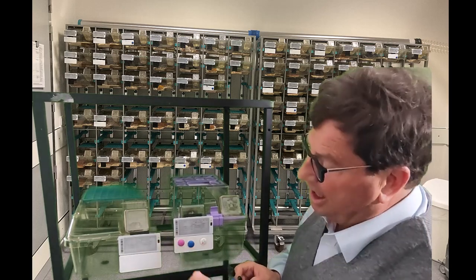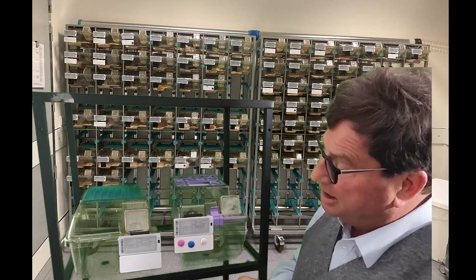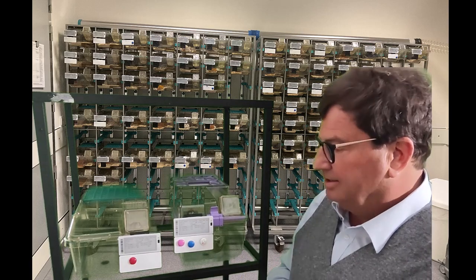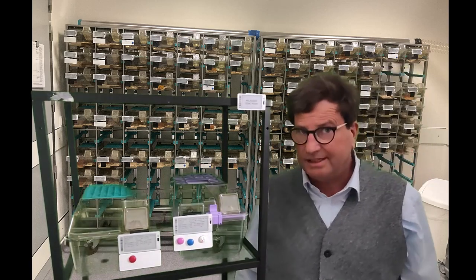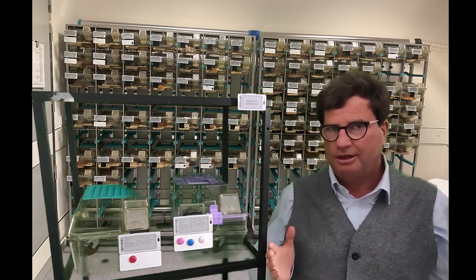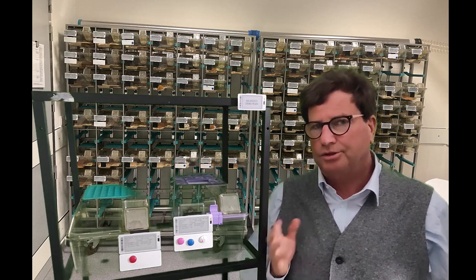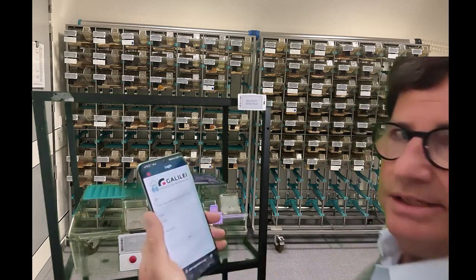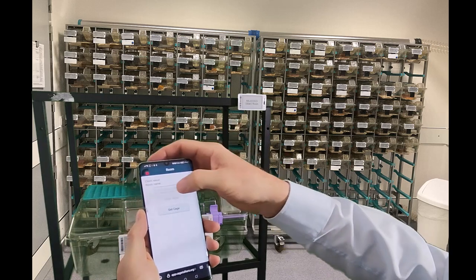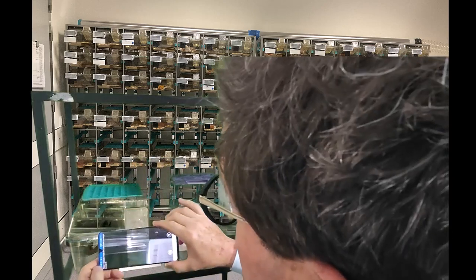And in our daily cage check, we found in this cage, which contains 2 animals, that one animal seems to be sick, so we mark this cage with a red button to get it checked later. But this is not enough. The veterinarian and the researcher have to be informed that in one of their cages there is a sick animal. In order to do this, I get my smart device and I log in to this app and I scan that cage with the barcode. Here it is.